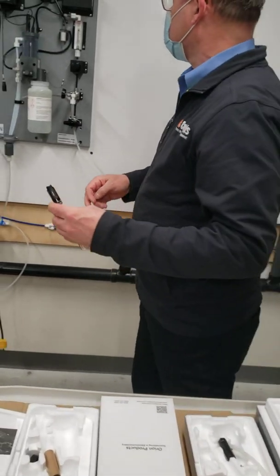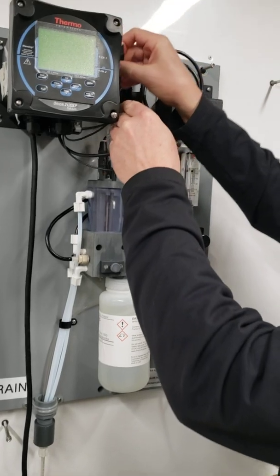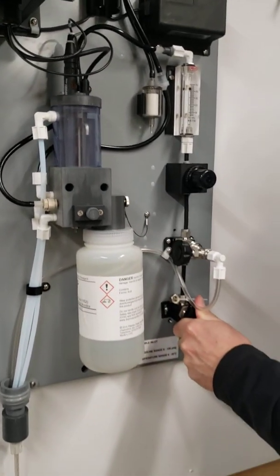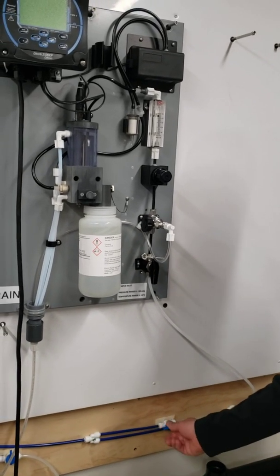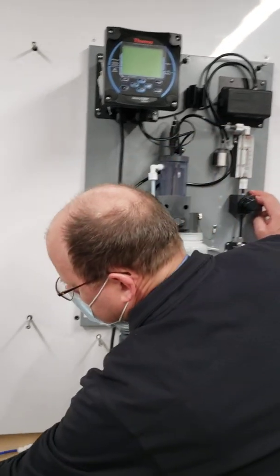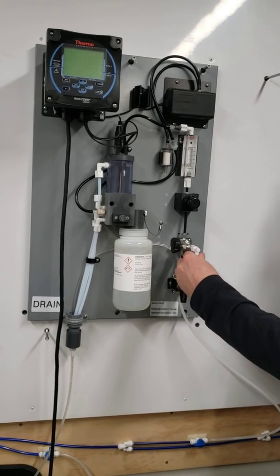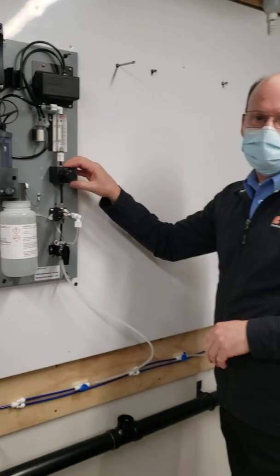Take this, put up the reference cable, lock that in there, turn the flow on, and then you're ready to go. We'll let it rinse down for half an hour and talk to you soon.